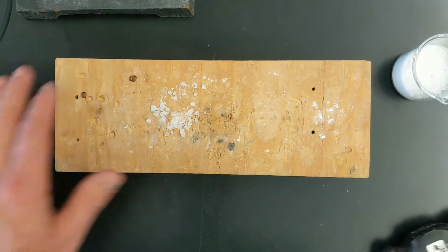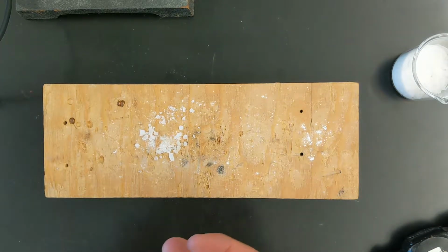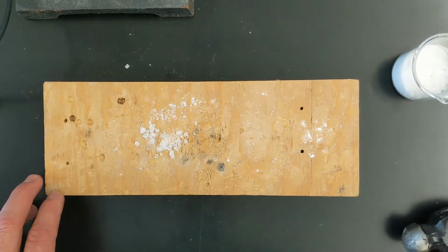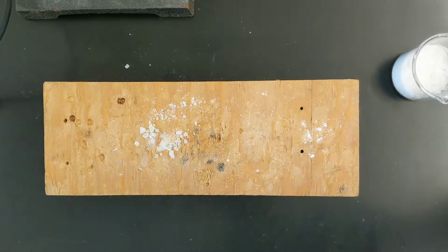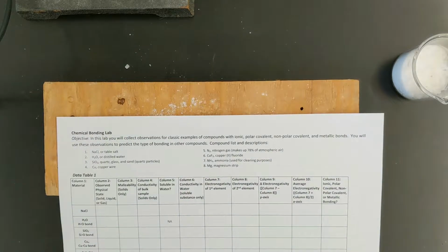We want to see here, does it crumble, or does it change shape but stay together? Think of it as, does it break or does it bend? In this case, salt definitely breaks, and so it is not malleable. Substances that are malleable will bend or change shape but stay together. So for malleability, sodium chloride is definitely not malleable.